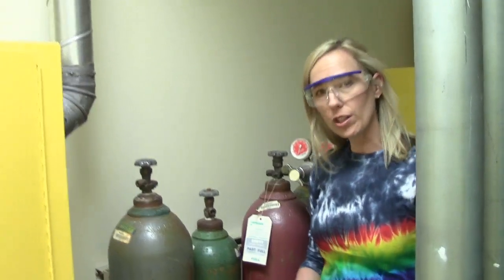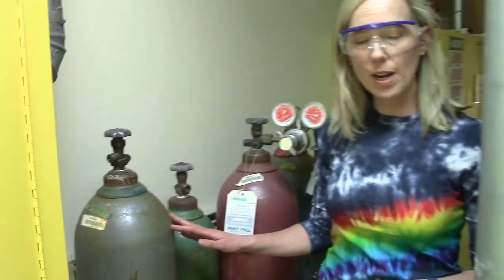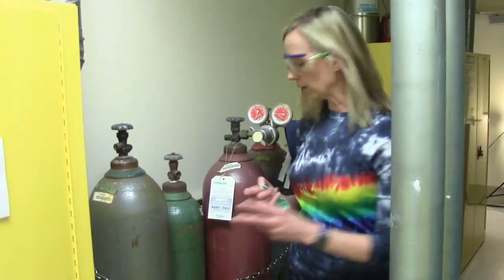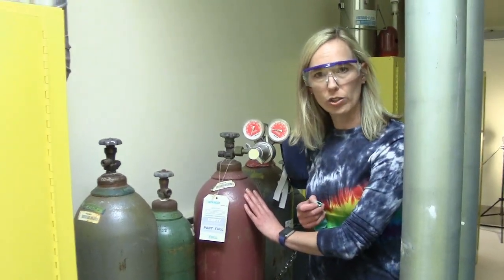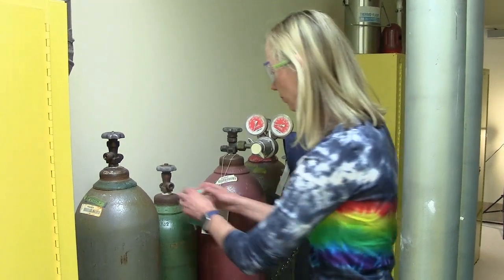The first demonstration that I'm going to show you is for a synthesis chemical reaction. So here I am in the chemical supply room, and in front of me I've got a whole bunch of gas tanks. So specifically what I'm going to try to do is take a balloon and I'm going to fill it with 2 different gases. One of them is oxygen gas and then the other one is hydrogen gas, and then we'll take it into my lab and we're going to do something that's pretty exciting with it. So let's just fill up the balloon with gases right now.